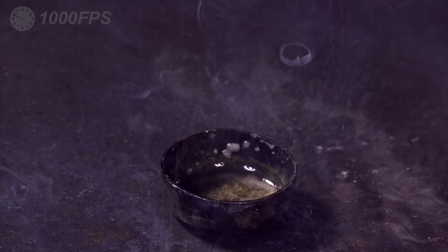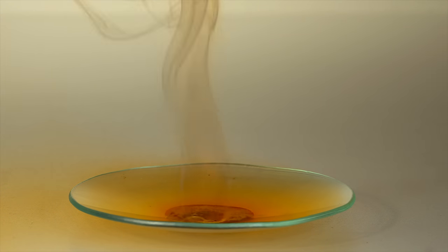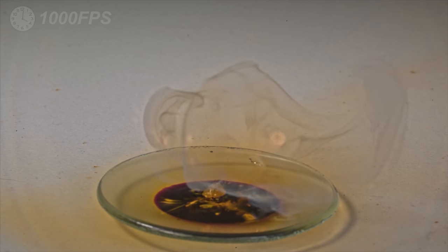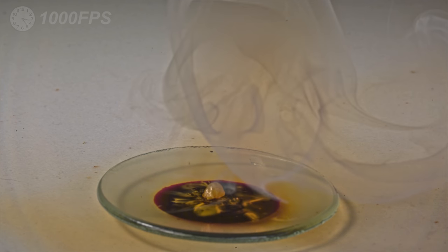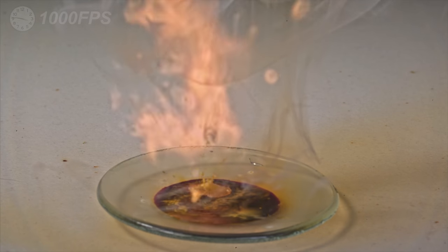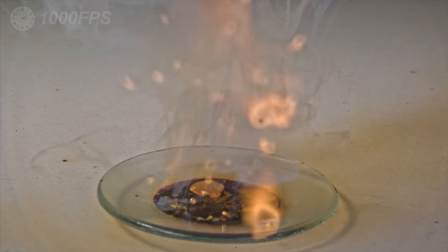However, white phosphorus explodes on contact with bromine. Unlike liquid chlorine, bromine ignites white phosphorus in carbon disulfide with ease.